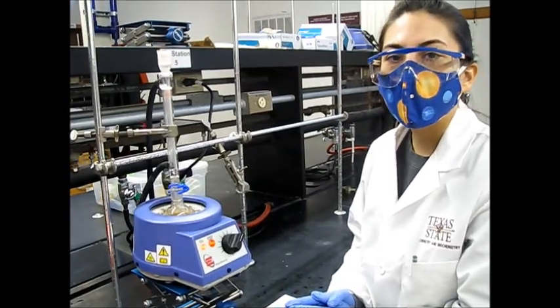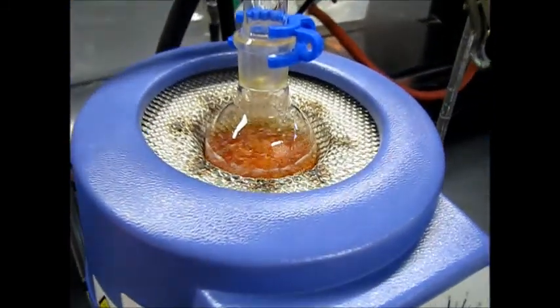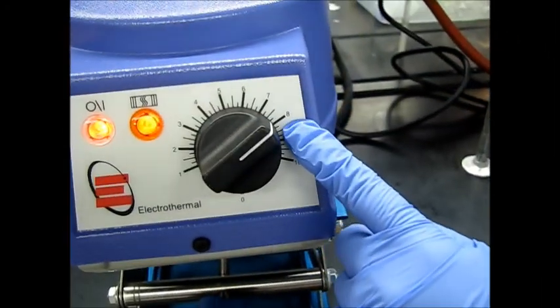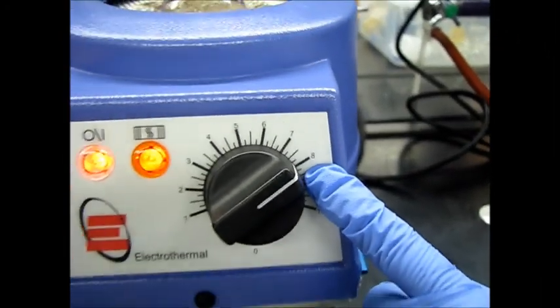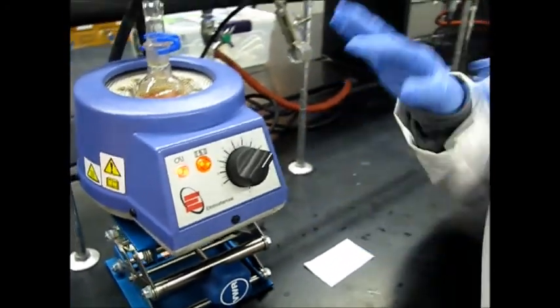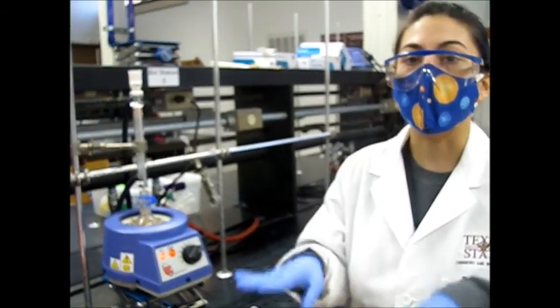So our solution is almost done refluxing. You have to make sure that everything has been dissolved before taking it off the heat. For heating, I would probably have it up around 8. It needs a high heat to reflux. And when you are done, make sure you wait before opening it and taking apart the apparatus. Wait for it to cool completely to room temperature.